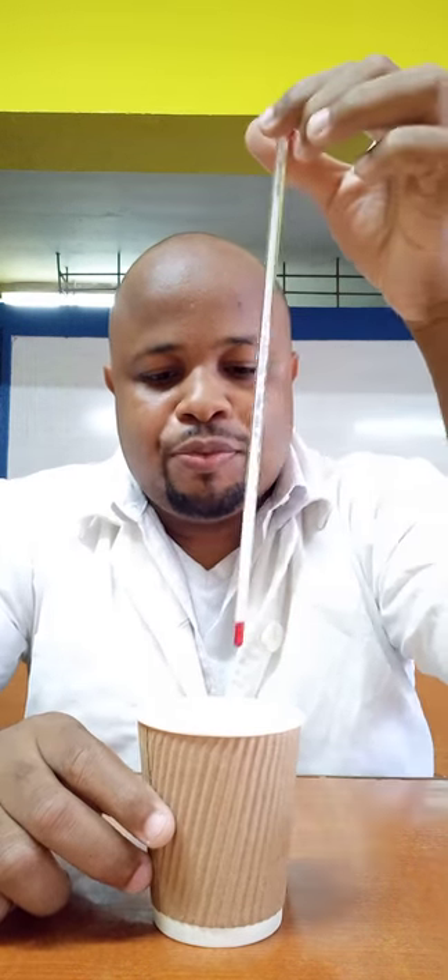To monitor temperature changes, I have a cup — it's not styrofoam but similar to a styrofoam cup — which prevents heat from being given off or lost to the surroundings. I'm going to measure the temperature of the water, then add the sodium thiosulfate, put the thermometer through, cover it up, and record the temperature again. The water has been in here for about five minutes or more, just to acclimatize to room temperature.